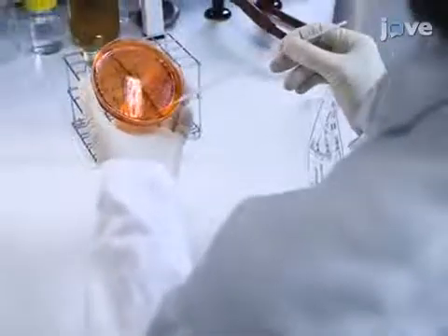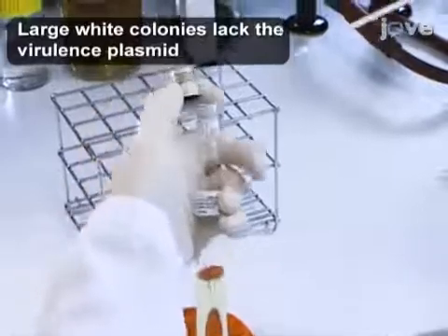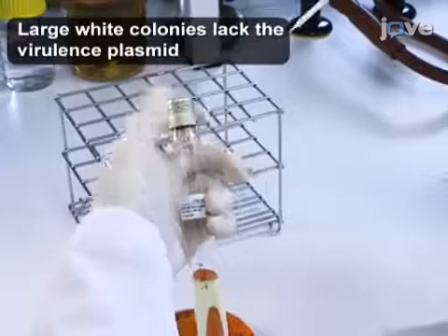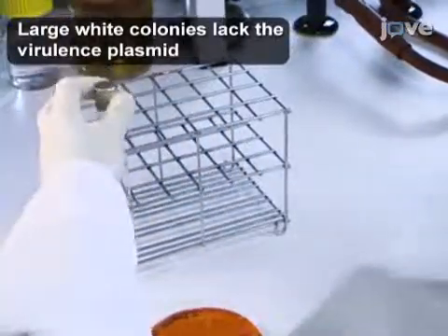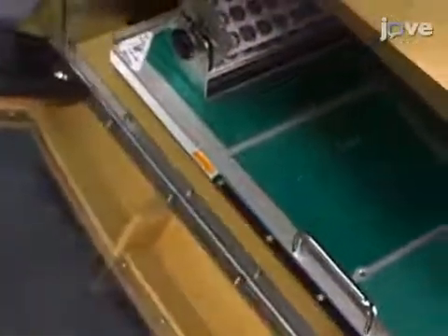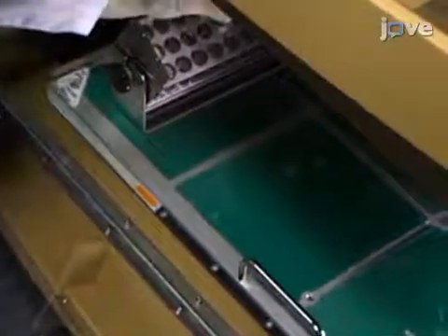Before beginning the challenge, inoculate a red S. flexneri M90T bacteria colony from a freshly streaked tryptic soy agar 0.1% Congo red agar plate into a 15 milliliter conical tube containing 8 milliliters of tryptic soy broth. After tightening the lid, incubate the colony overnight with shaking at 222 rpm and 30 degrees Celsius.